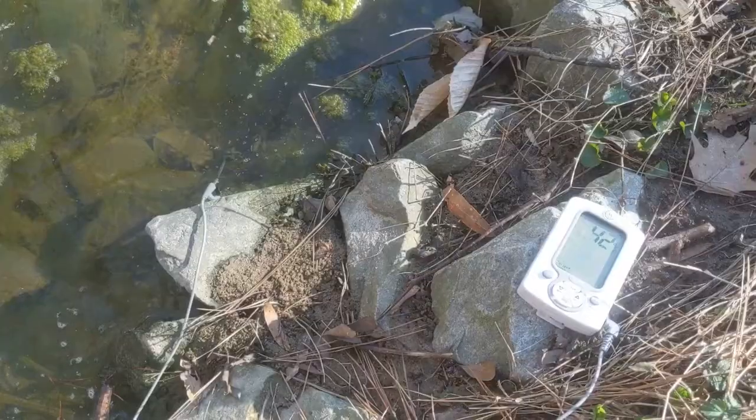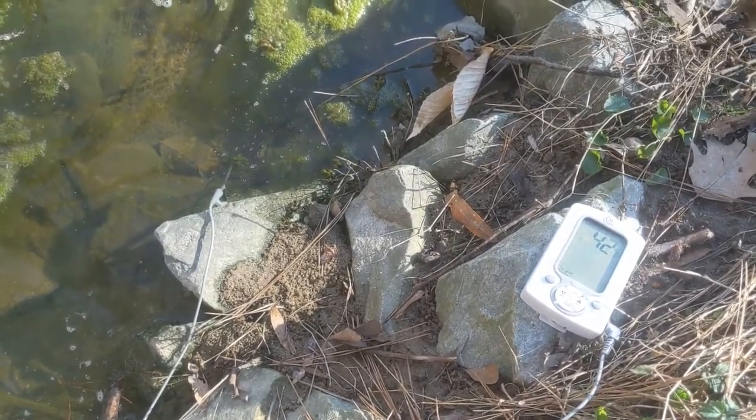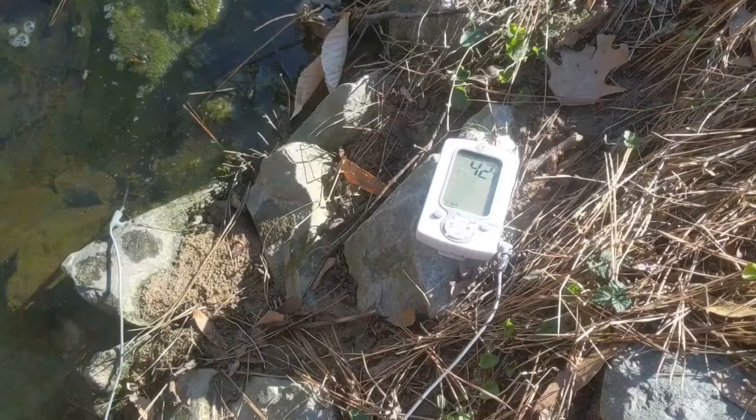The first test that you're going to do once you collect your water, when you do your water chemistry survey, is the temperature test. First you want to set this up. I just took a thermometer that I have in my kitchen, and I set the probe part in the stream, and I let it sit while I collect my water sample so that it can take a minute and equalize to the temperature of the water.